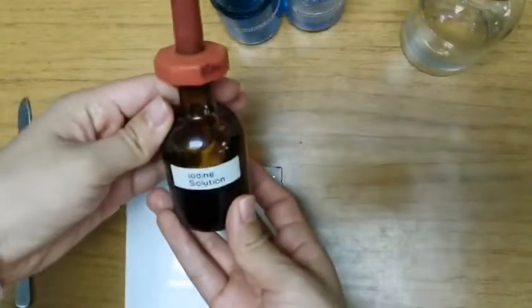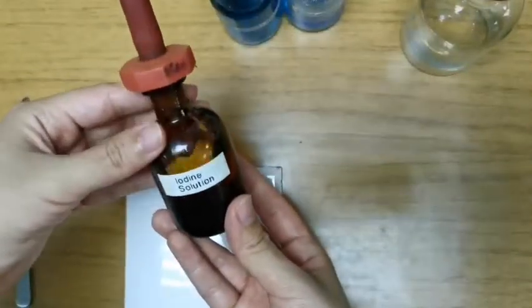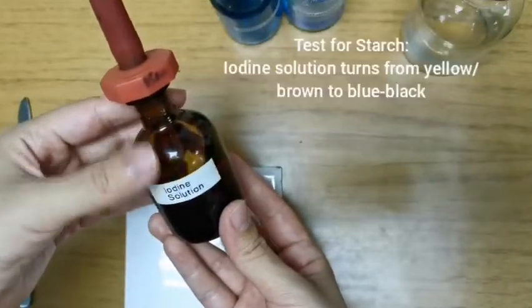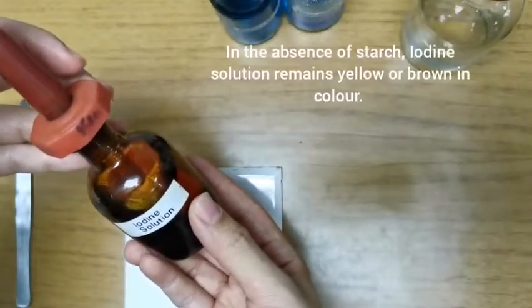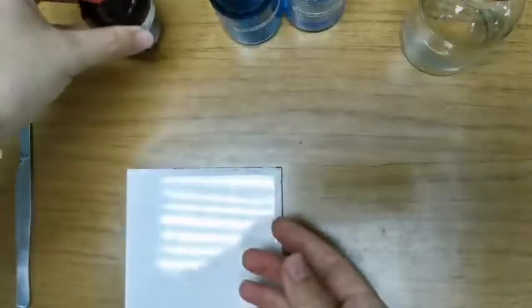Iodine solution is yellow-brown in color, and in the presence of starch it turns from yellow or brown to blue-black. In the absence of starch, you would write that iodine solution remains brown or remains yellow in color.